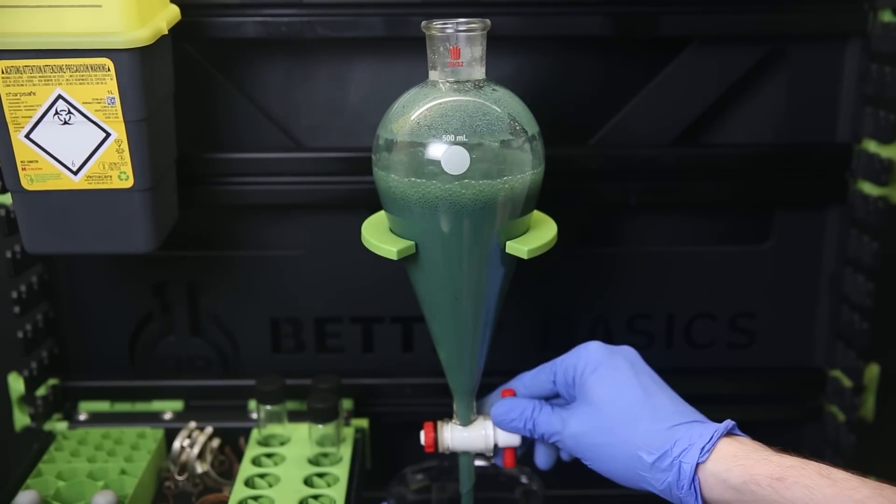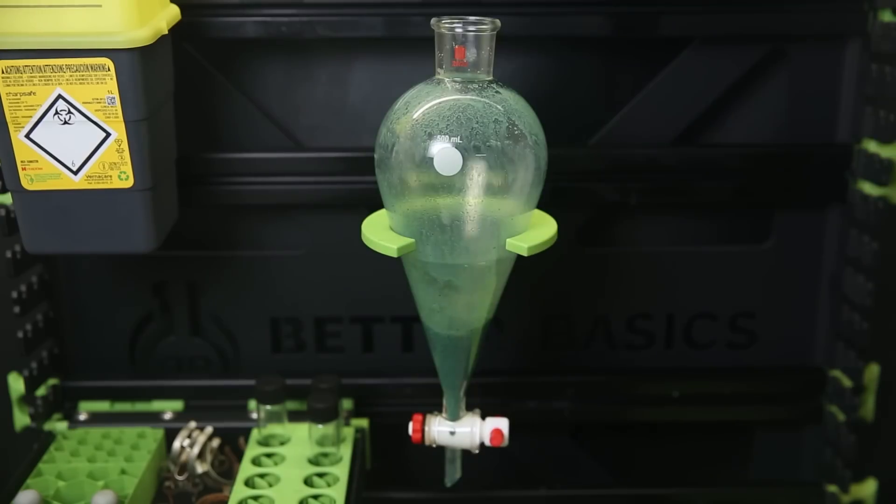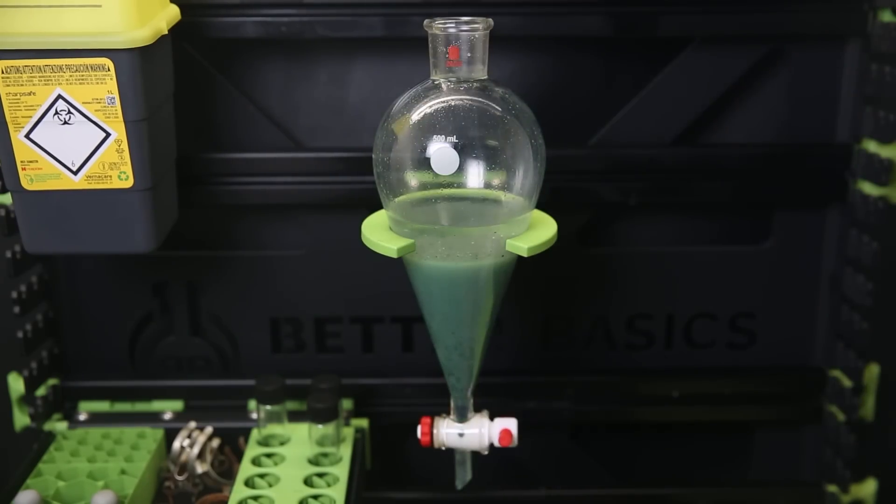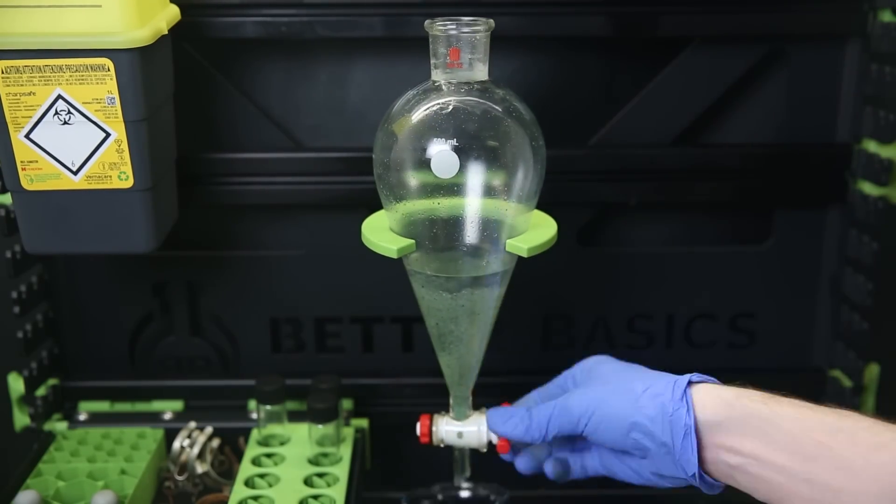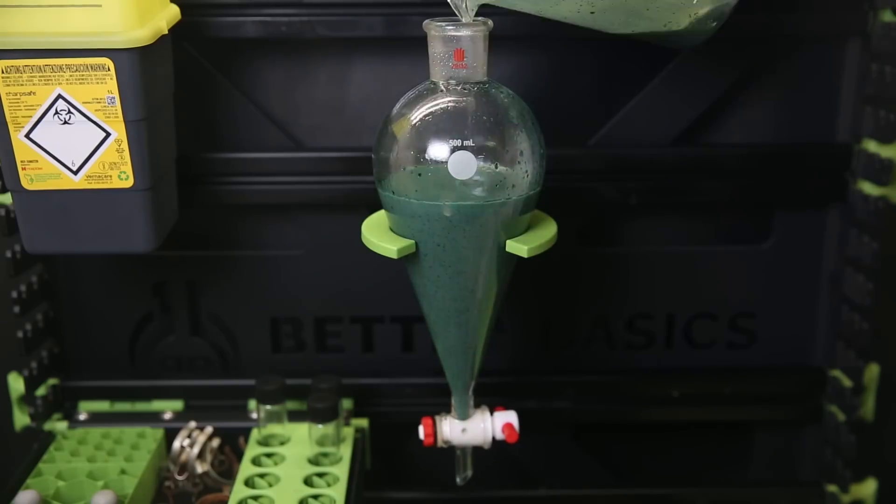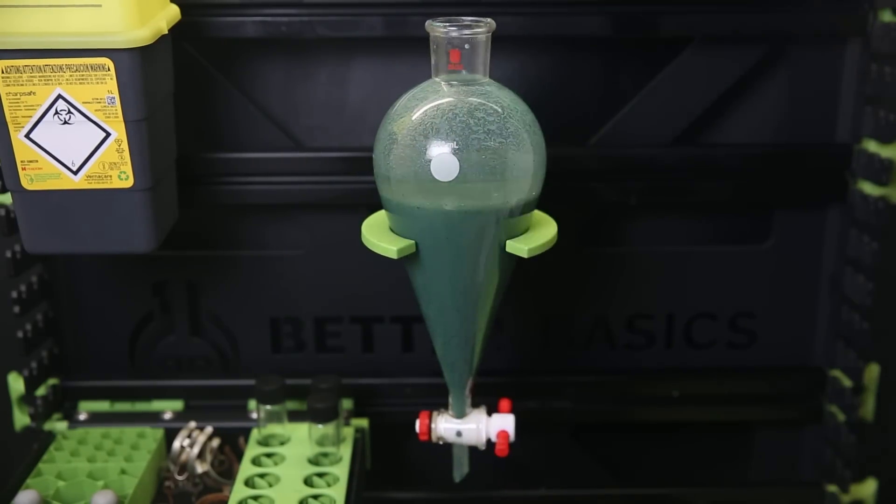The separation is quite poor because of all the solids floating around, so I separate them more roughly. I also add some water to the last bit to get better separation. I then extract all of the mixture twice with diethyl ether.